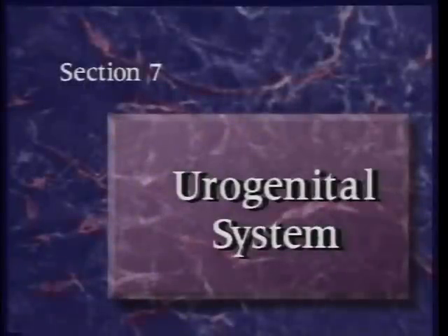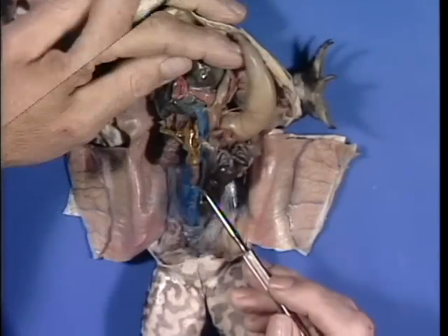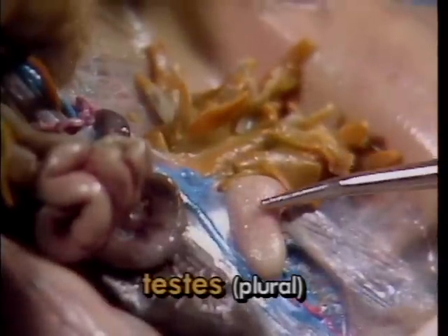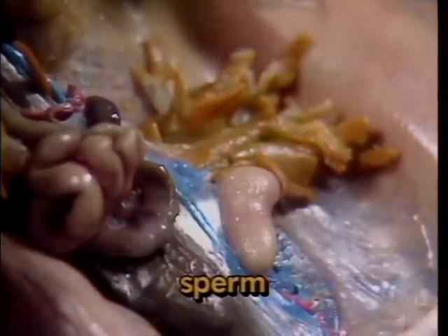In the majority of male vertebrates, there is a close association between the urinary system and the ducts which transport sperm. Amphibians are no exception, and so we will consider the male urogenital system first. The 2 small, light-colored oval structures are called the testes, here and here. Each testis is responsible for producing male gametes, called sperm.